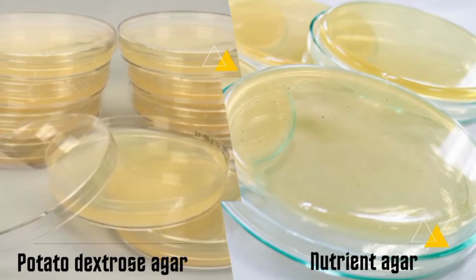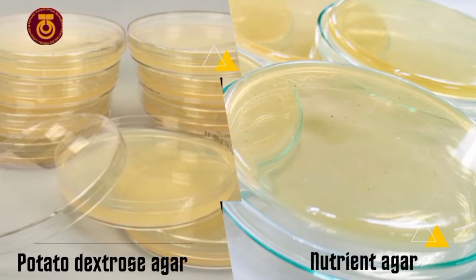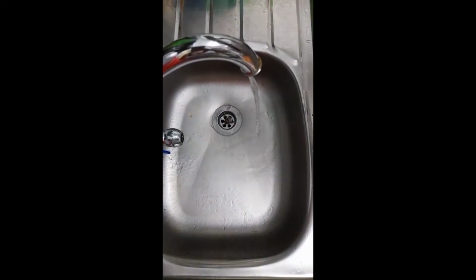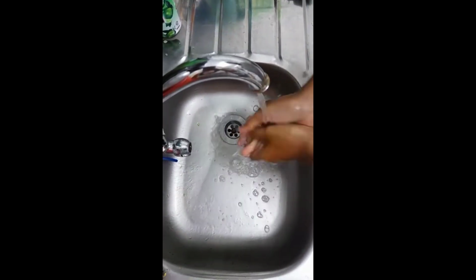In this part, we are making 2 different agar media, which are potato dextrose agar and nutrient agar. First things first, before we start preparing our media, we must first make sure our hands are clean and dry.